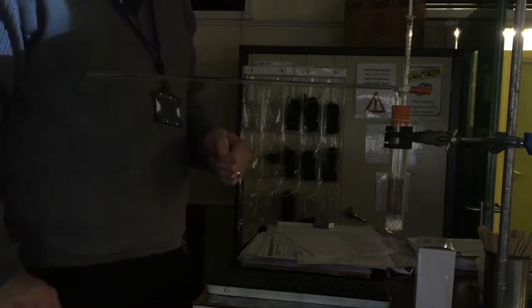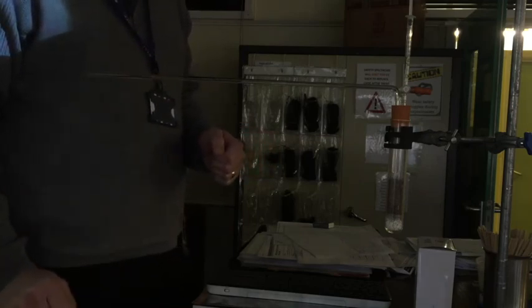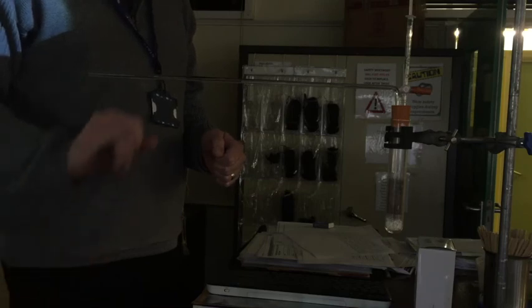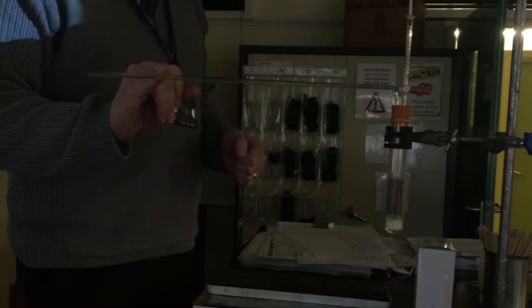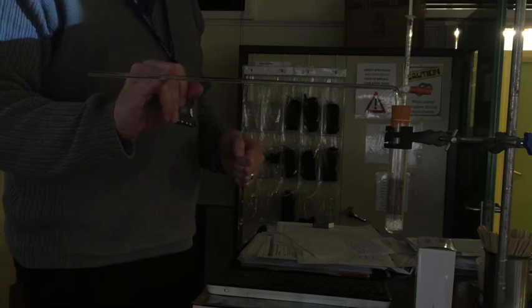And I can already see this is moving quite fast now. Off it goes. I can put my finger where it is just in case you can't see it. Still going, still going, still going.